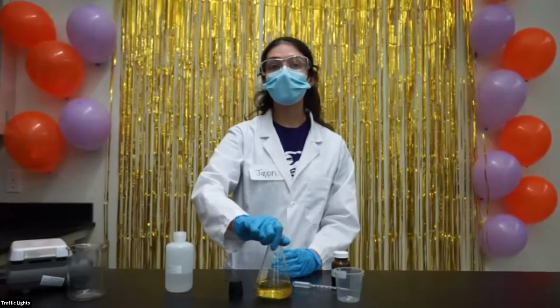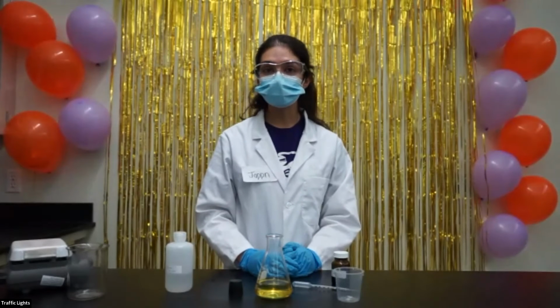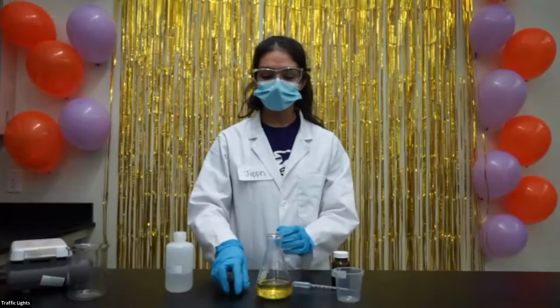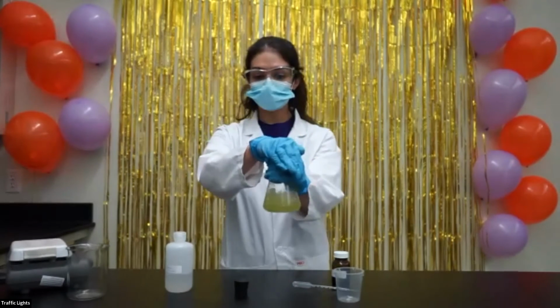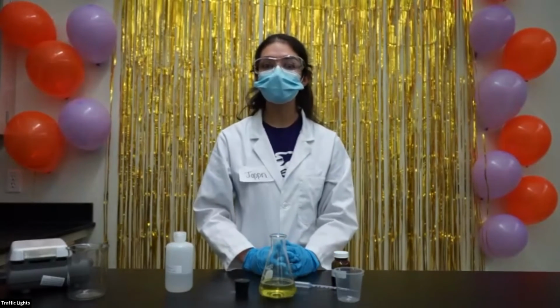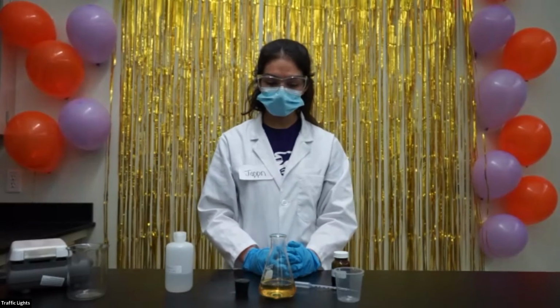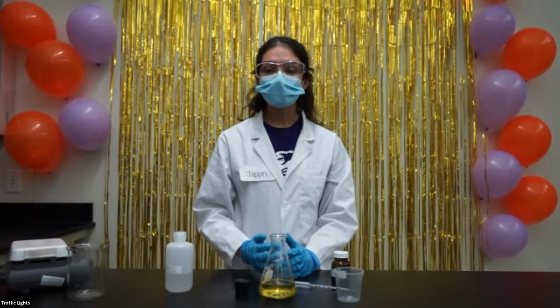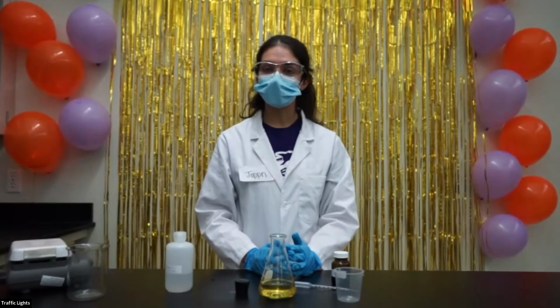And the reason you're seeing red is because only some of the indigo carmine particles are being oxidized. So we get a mixture of the red and the yellow and the green color. On the other hand, when I shake the flask, it turns green. And this is because a lot of oxygen is able to be dissolved in the flask, so all the indigo carmine becomes oxidized and the solution becomes a green color. And then when I let it sit for a bit, the oxygen comes out of the solution, so the indigo carmine is reduced again, and we get the original yellow color.